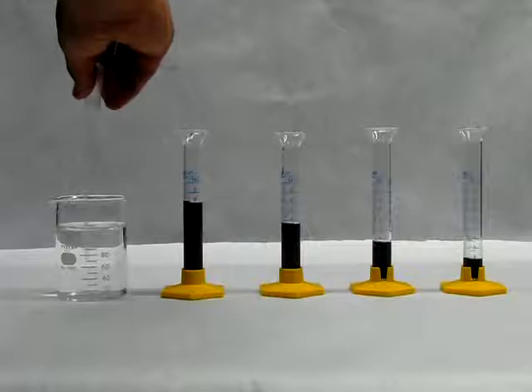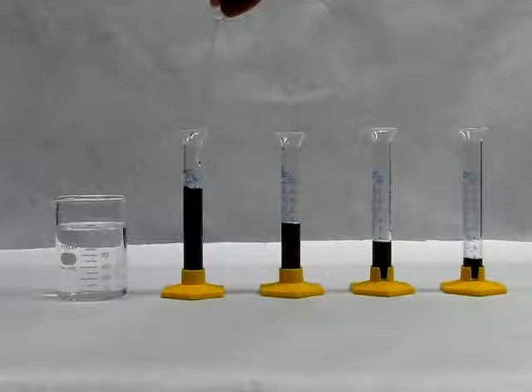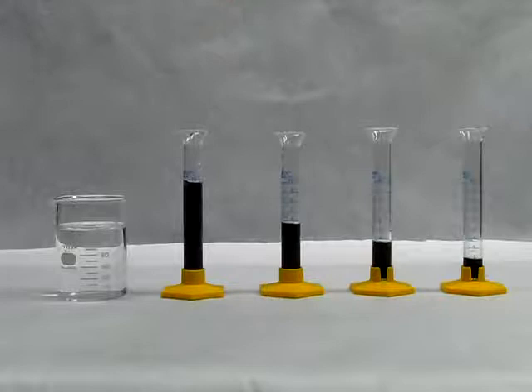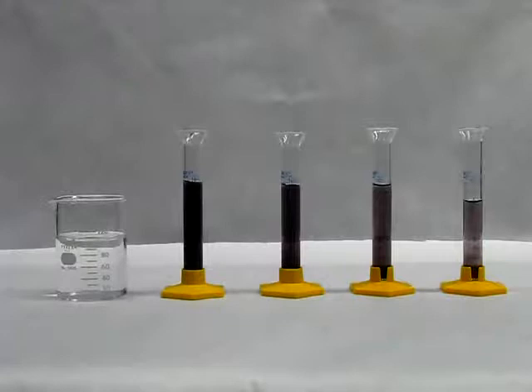Once you finish adding your stock, you will fill up the graduated cylinders with water. For simplicity, all of our solutions have the same final volume. Can you calculate the final concentration of the different solutions?